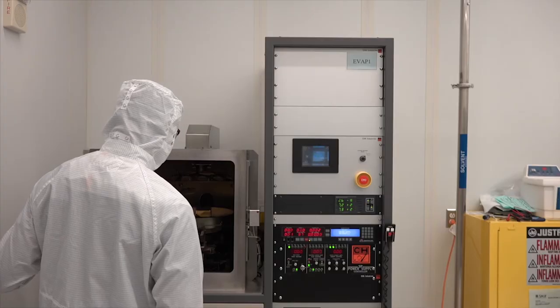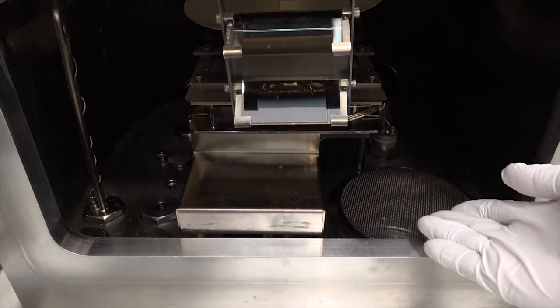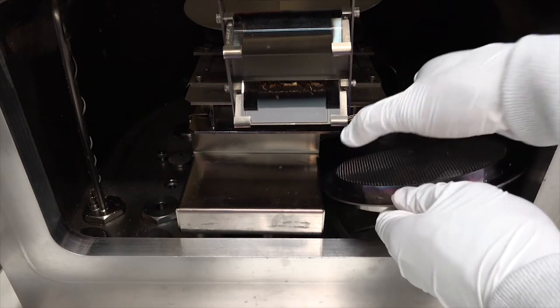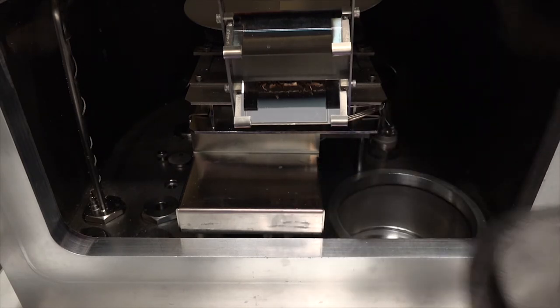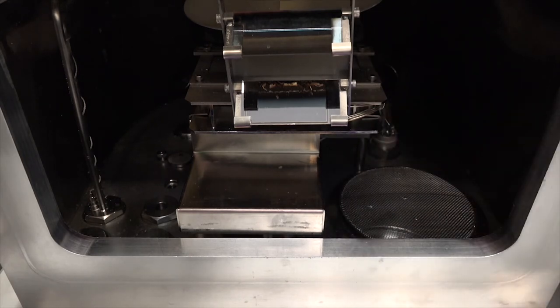This vacuum chamber uses a mechanical pump and a cryopump. Here is the port that leads to the cryopump located under the vacuum chamber. Of course, this valve is currently closed as we cannot expose the cryopump to room air.